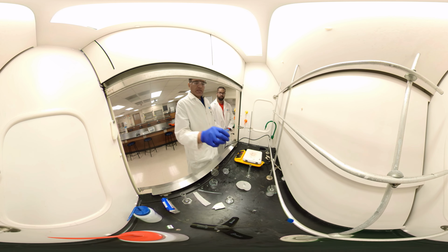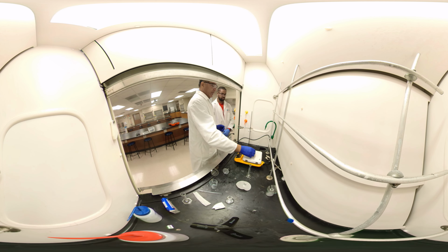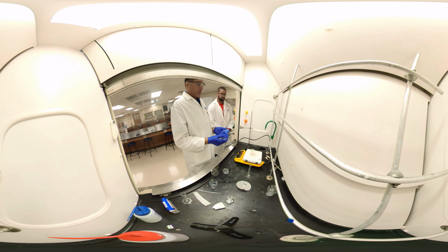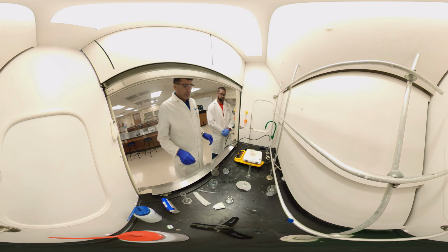And this one, we have acetaminophen dissolved in ethanol. We'll heat it slowly. If you heat too fast, your compound will burn. So we have to evaporate slowly. We'll keep watching while it dries. It will keep going.